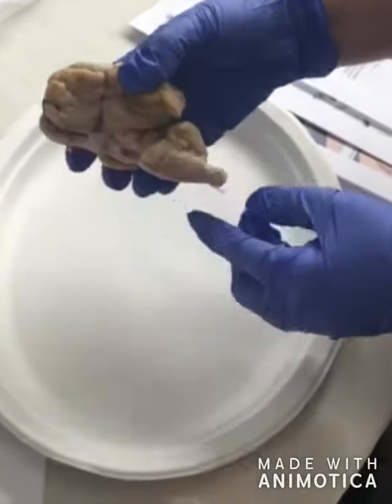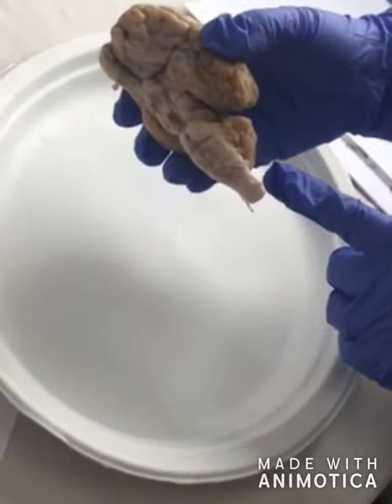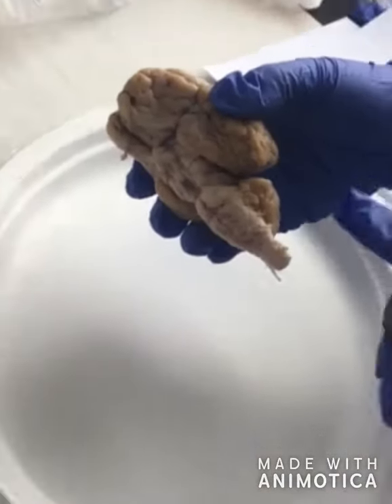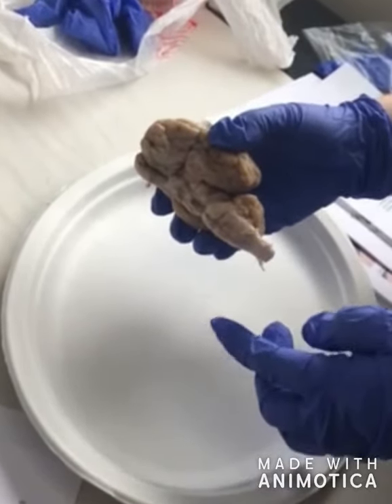So when looking at the spinal cord, this side is going to be dorsal, superior, and the bottom of it is going to be ventral, inferior.